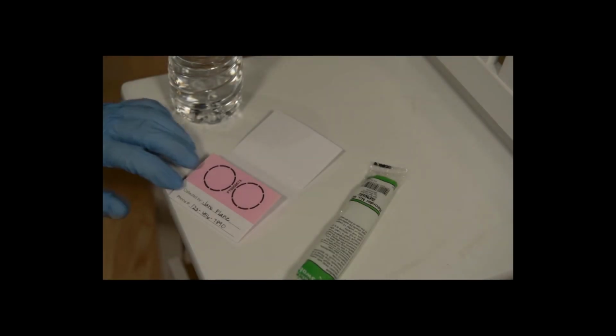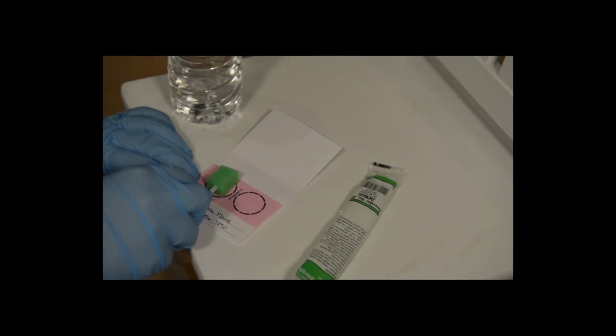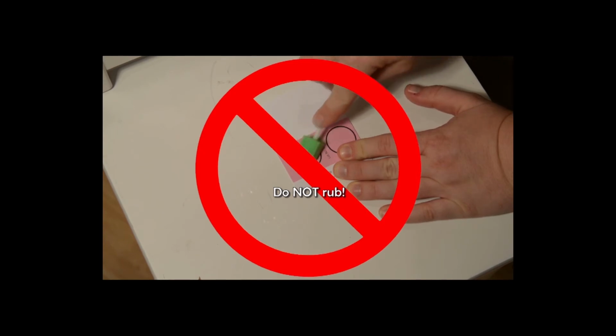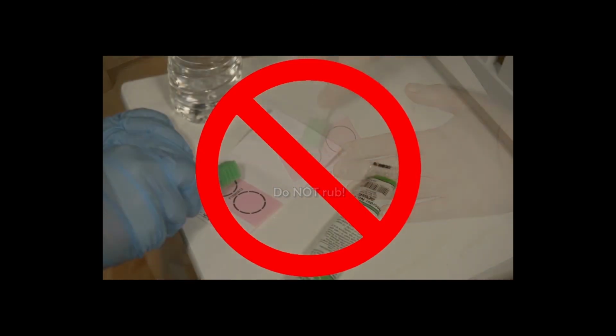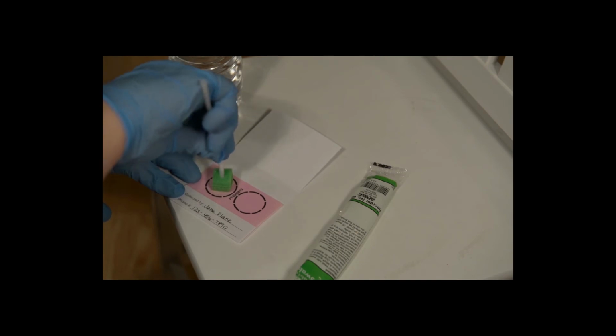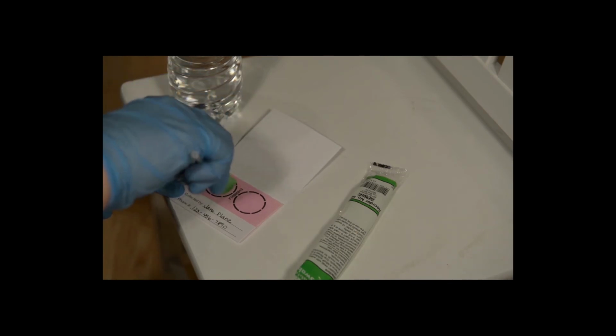Open the DNA sample card to reveal 2 pink circles. Press the swab onto the first circle. Do not rub. Be sure to press down with all sides of the swab. You will see a slowly developed color change to white where adequate contact was made. Discard the used green swab.